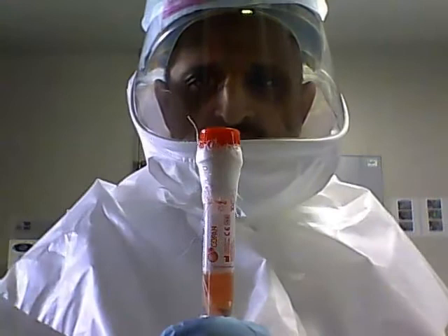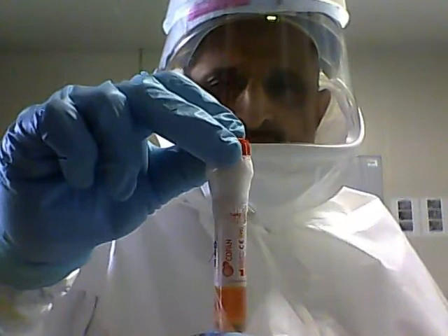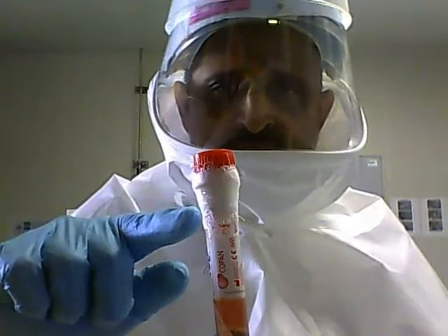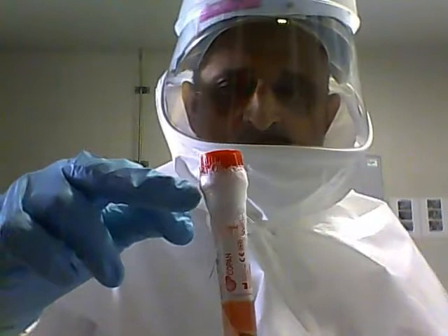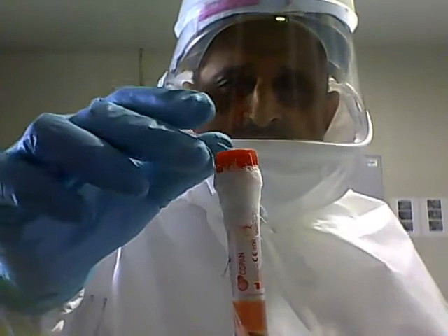I cannot reveal the details of the patient as this is a patient-derived sample. This sample is basically a serum sample, as you can see in the tube. Note that there is a small wad of bandage here. When I open this sample in the biological safety cabinet, any serum which drips from the tube will be trapped by this wad. It will not spill onto my gloves and cause a breach of containment. This is one of the key aspects of transporting samples from hospitals.